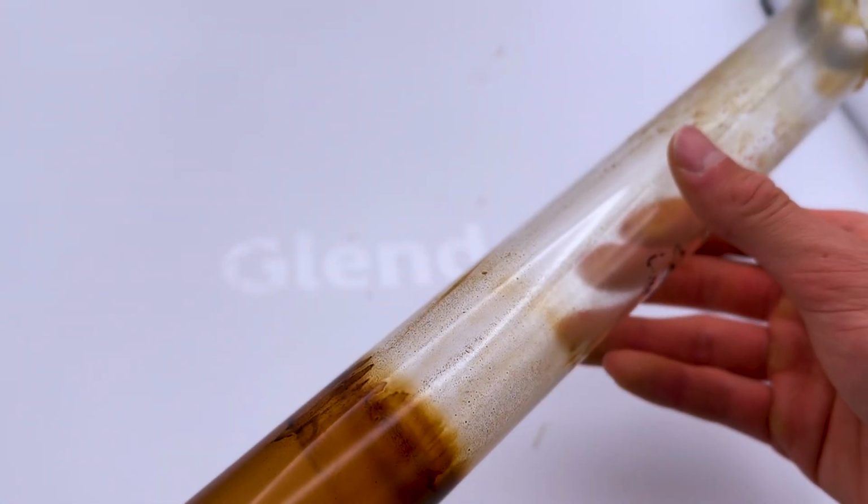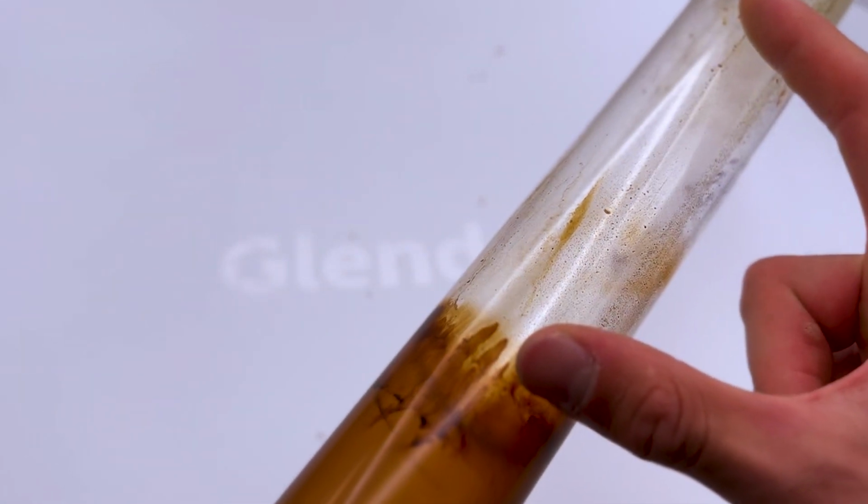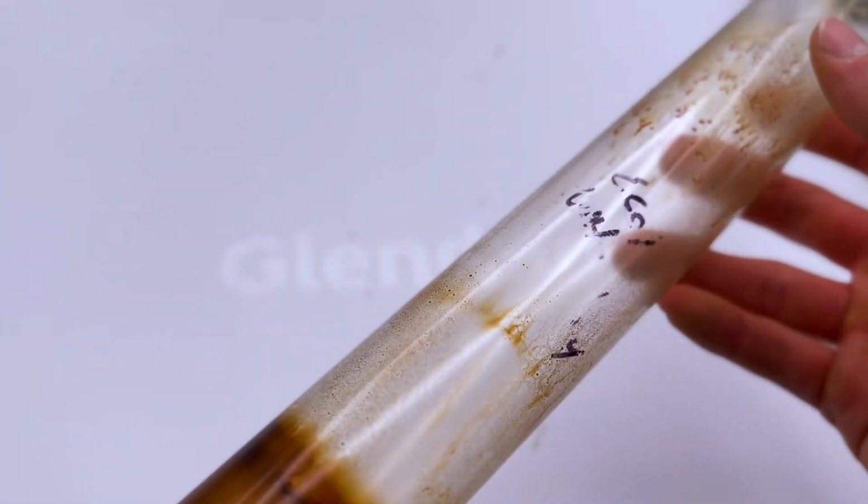Now, when the condition of glassware is being analyzed, there's two very important parts of the glassware that we look at. First, we have the fluid space down here. This is where the oil actually goes when conducting the TOPP test. And secondly, we have the head space up here. These are two very important separate metrics that we need to quantify.